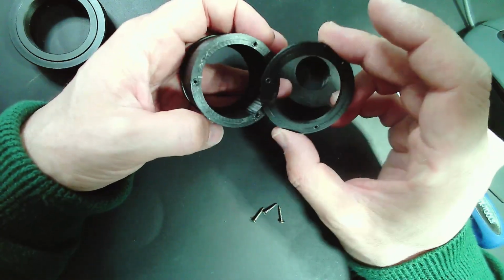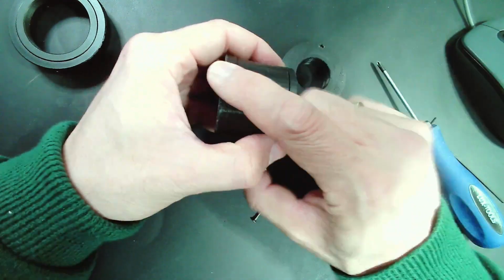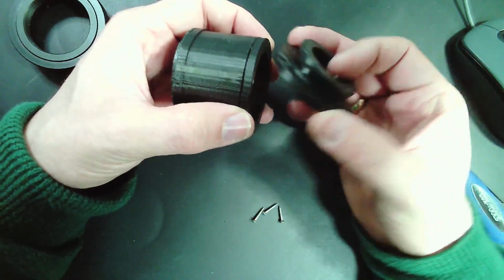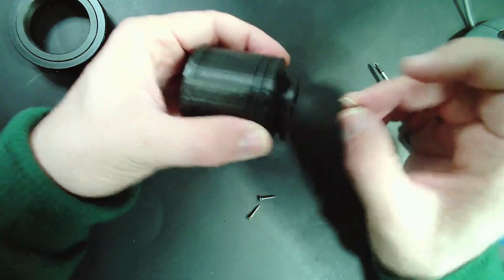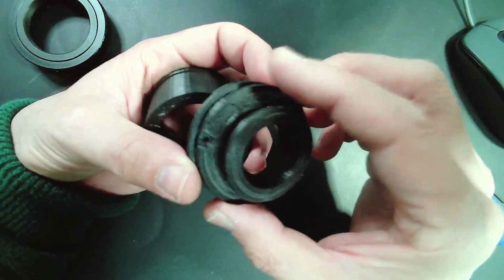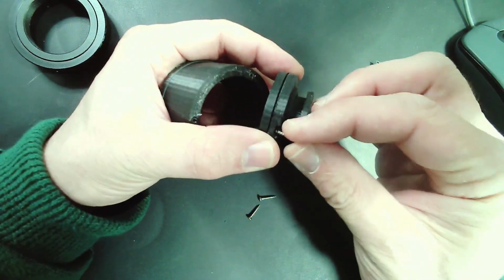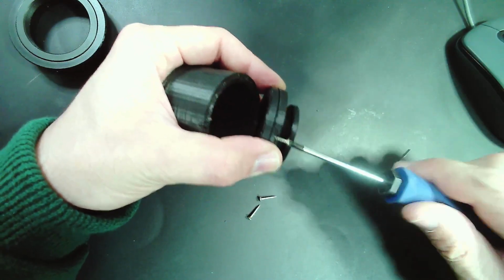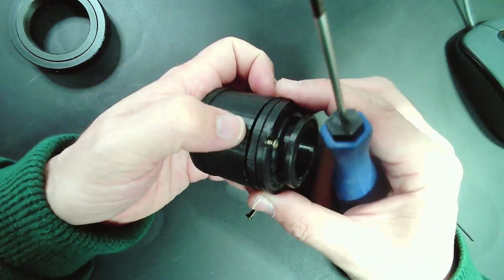So when you want to make this yourself, then I suggest that you simply print everything in one piece, okay? And of course, everything goes together here, and I'm using three screws here to hold everything together for ease of printing. Now, I simply place the screws anywhere here, so I have to see that I'm actually able to, I hope that this was the right one. I have to then put everything back. So I drilled a few holes, that's pretty straightforward, okay? It goes in here.